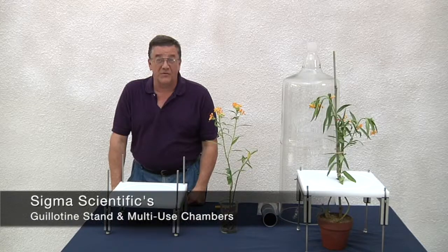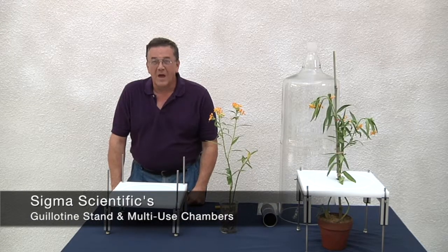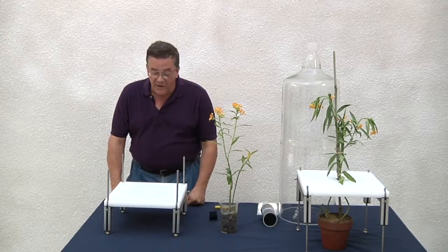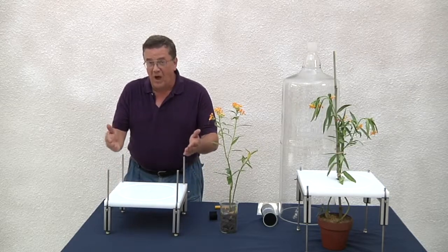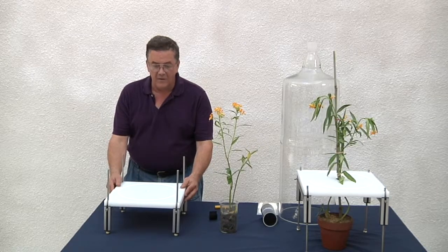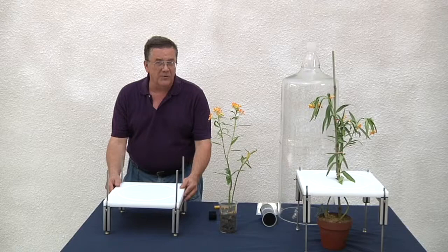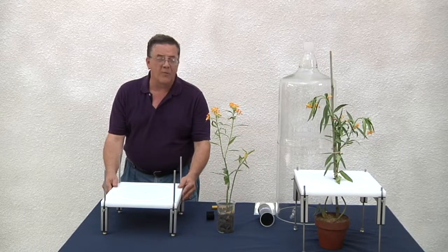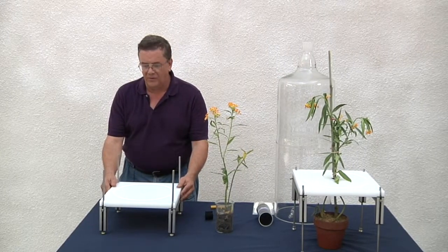Hi, I'm Jim Esterberg with Sigma Scientific. I'm here to show how to set up our new adjustable height guillotine stand for our vacuum volatile collection and also for olfactometry.